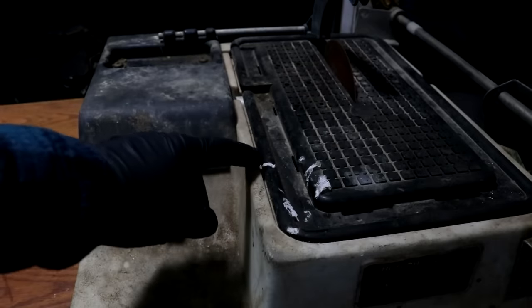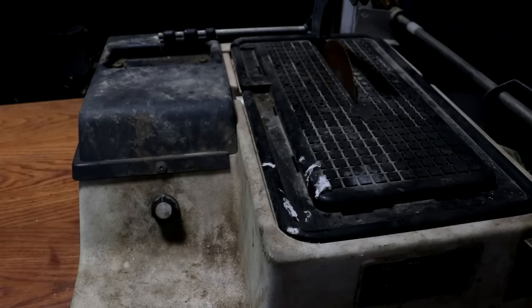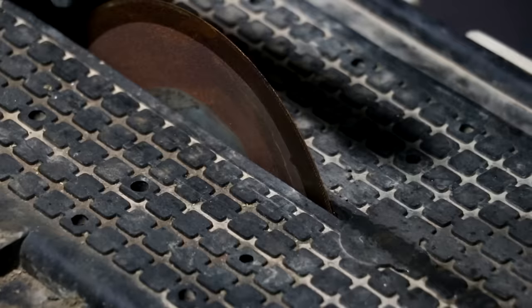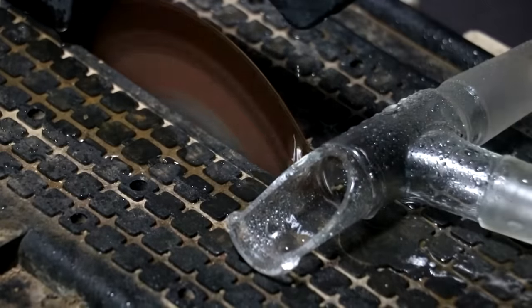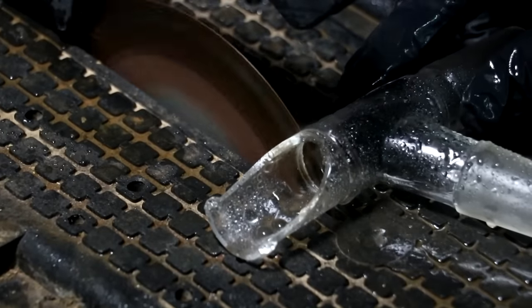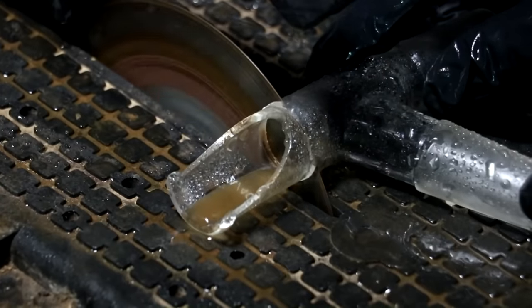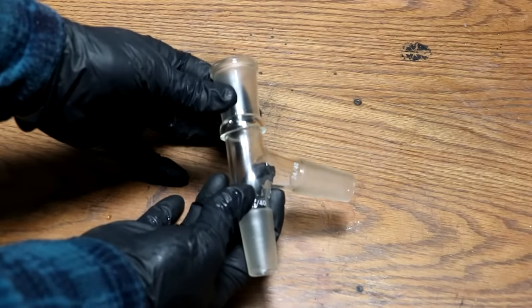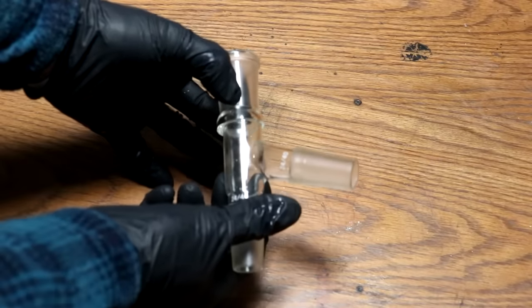So I went and I dug up this old tile saw here. It's not the cleanest, but it still works. Makes a lot of noise though. It's got a diamond blade, and I should be able to cut glass with it. So here's the two pieces cut, and I need to join them right there. This piece looks like it's a lot larger, but it's just kind of flared out. When I heat it, it should shrink in.